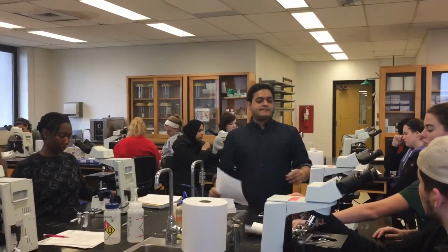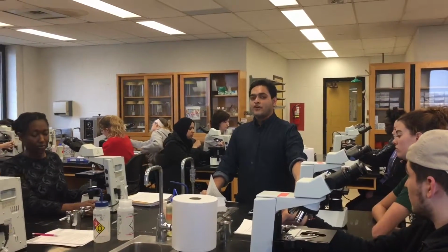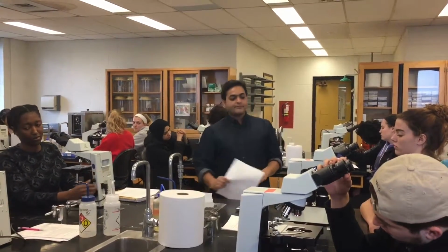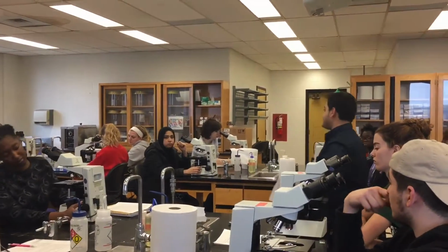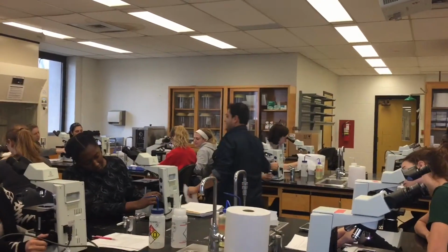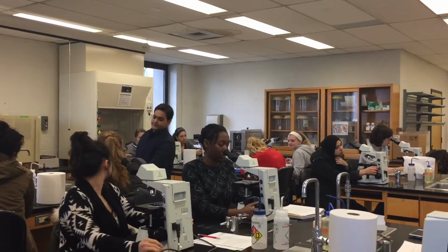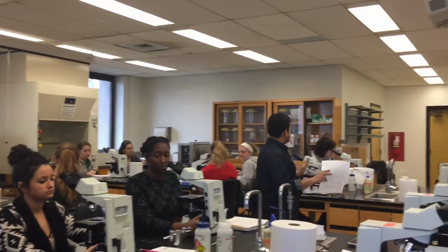Next thing is the button on the right, it turns the microscope light on or off. Right now you see it on, the light going through. You can turn it off or on. Okay, that's good. And the knob on the right adjusts the intensity of the light. It should be a knob in there. This guy adjusts the intensity of the light. That's good. Everyone is following me here? Good.